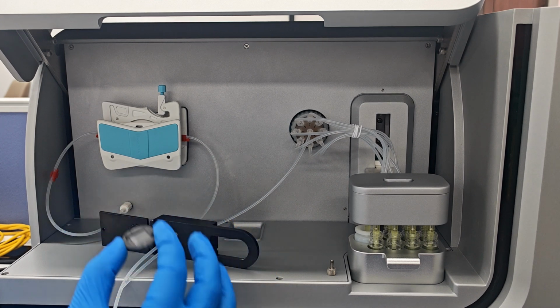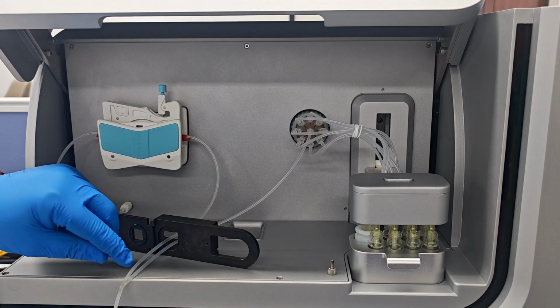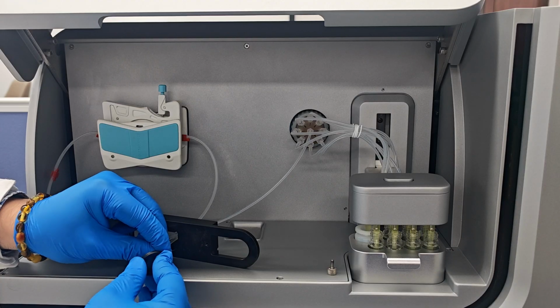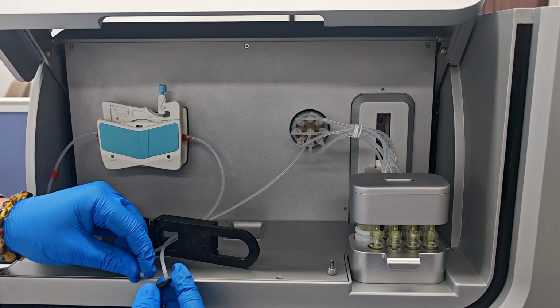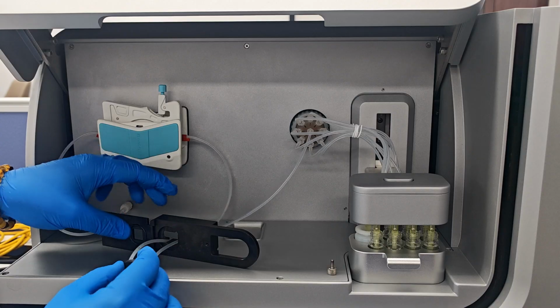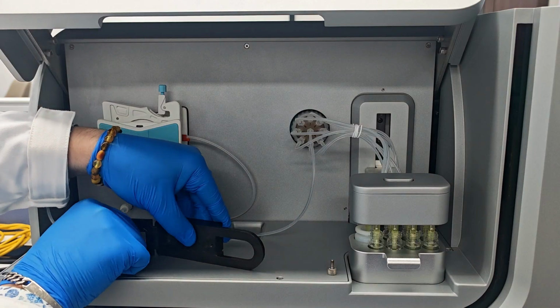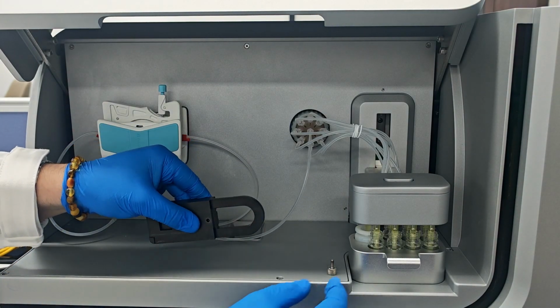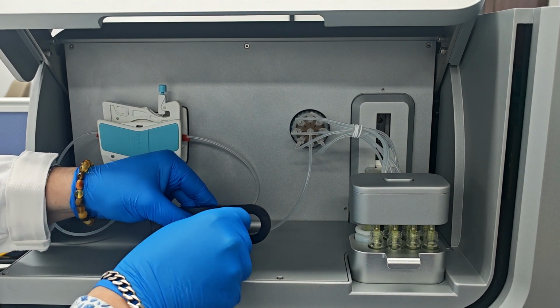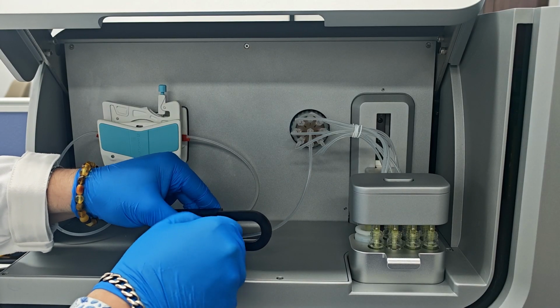So now we are putting the new chip back to our holder. We have our inner tube here and outer tube here. We put the inner tube to the inner place on the chip, and we put our outer tube to the outer place on the chip. Simple as that. And we insert this chip back to the holder like this one, and we simply close our holder like that. We hold this and we screw one bolt inside the holder like this. We screw it like this one to make it tight.